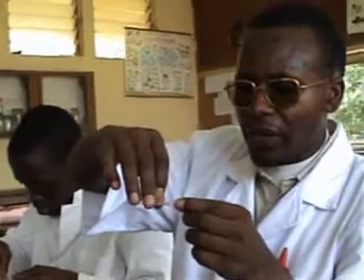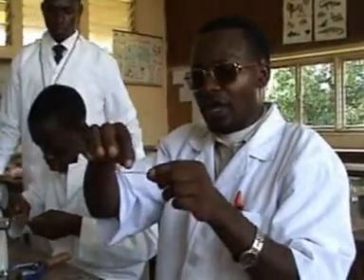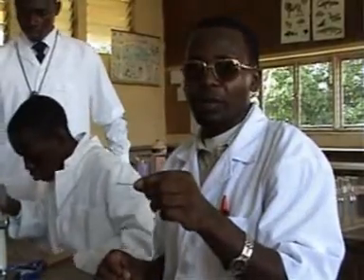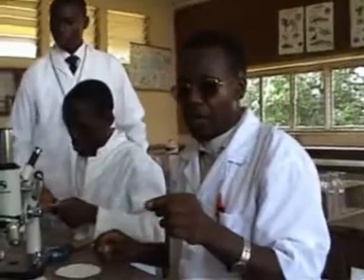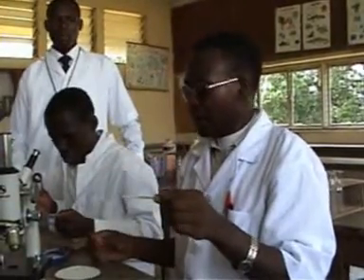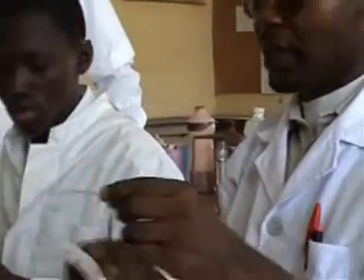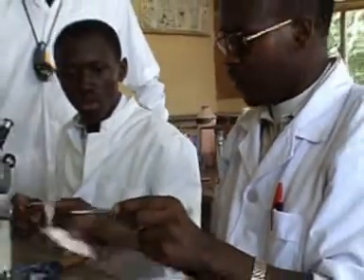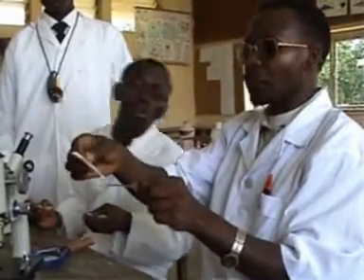So when I cover it, eventually, it lies on top of it like that. So when the cover slip is lying on top of my preparation, then what I will observe is that the water which I had put there is more than what I require. So what I will then do is that I will take a filter paper. This is a filter paper. This one.